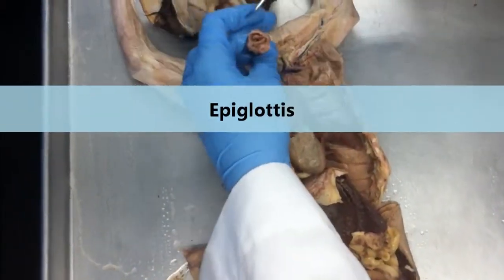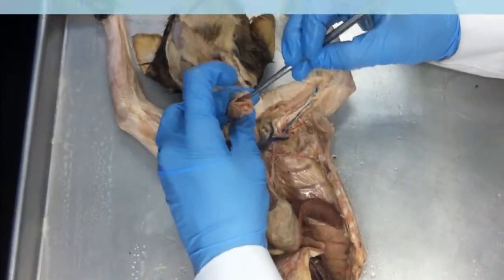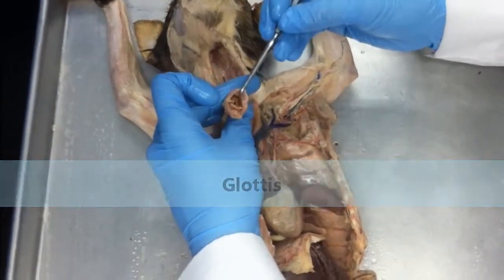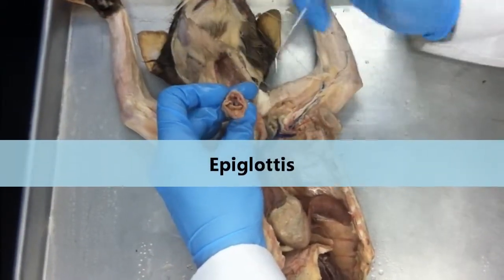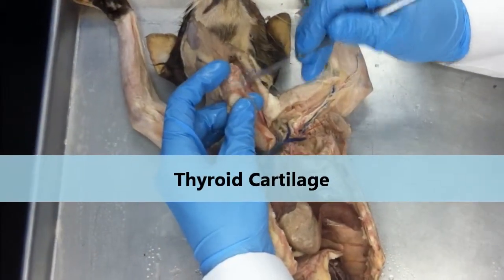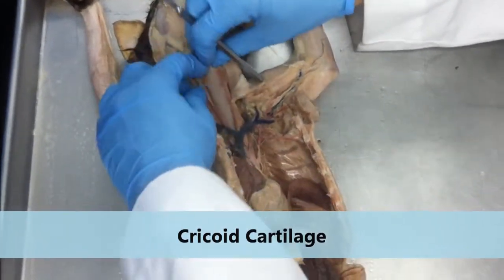Here's my respiratory system. I've got my epiglottis. This is my flap of tissue that's going to cover up my windpipe when I swallow. The glottis is the space between the vocal cords. Here are my vocal cords, these two flaps of connective tissue here. If I pin this, this is the epiglottis. Covering the vocal cords on the outside, we've got thyroid cartilage. Below that, we've got cricoid cartilage. Okay? Stick that little bugger back in there.